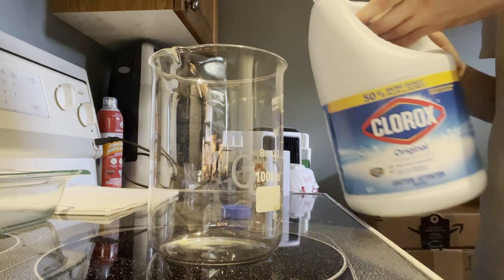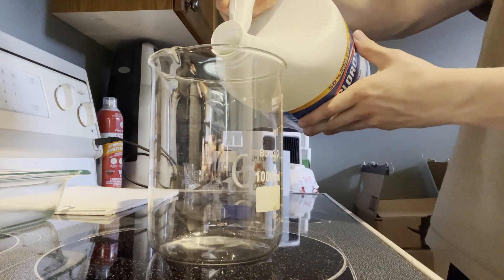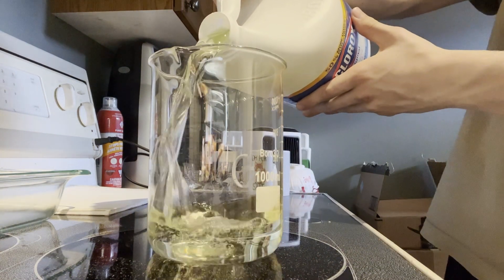To begin, 550 milliliters or 582 grams of 8% bleach was weighed out and placed into a beaker.